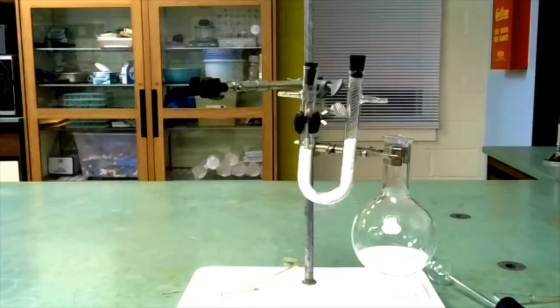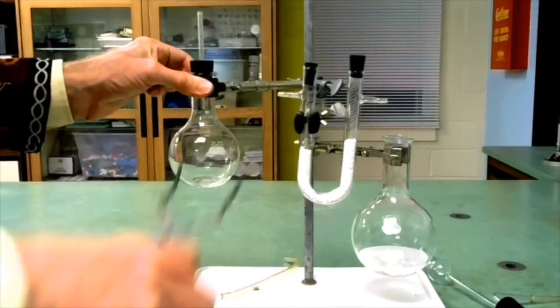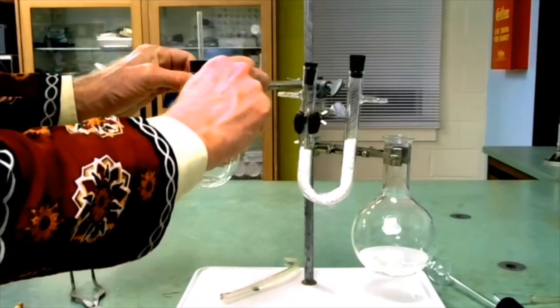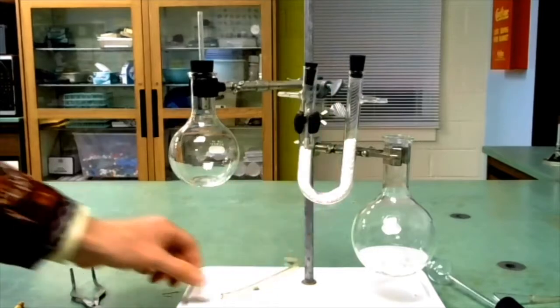Now let's reassemble the apparatus. We'll make sure this is nice and tight. Make sure the stoppers are nice and tight.